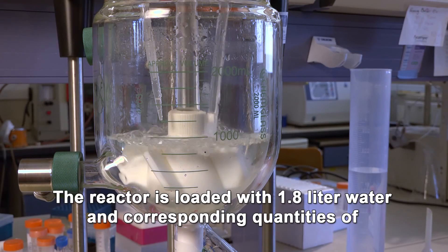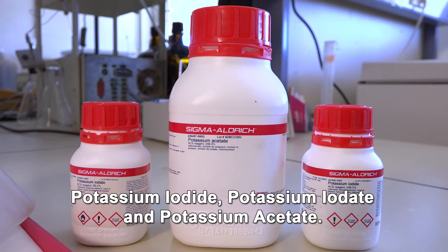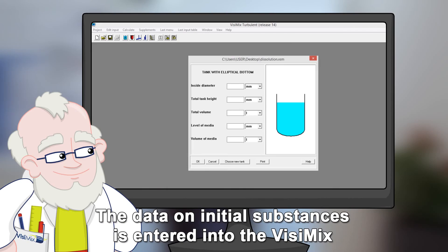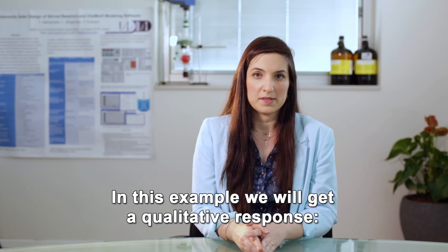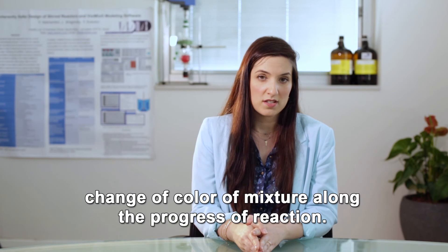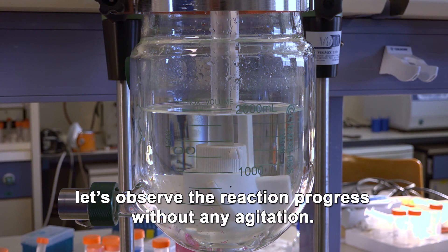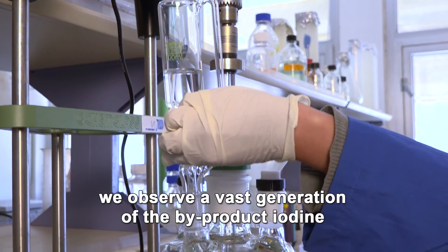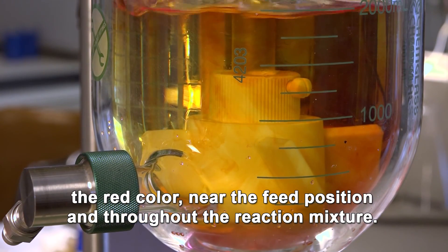The reactor is loaded with 1.8L water and corresponding quantities of potassium iodide, potassium iodate and potassium acetate. The HCl is dripped into the reactor. The data on initial substances is entered into VisiMix as described in the previous video. In this example, we will get a qualitative response — change of color of the mixture along the progress of reaction. Initially, to illustrate the performance of the reaction system, let's observe the reaction progress without any agitation. It is clear that without agitation, we observed a vast generation of the by-product iodine — the red color — near the feed position and throughout the reaction mixture.